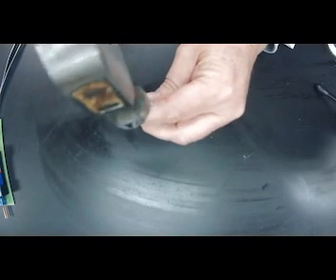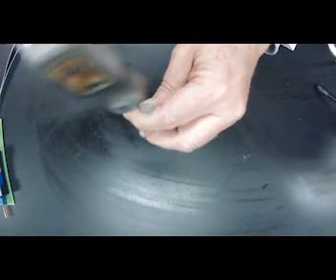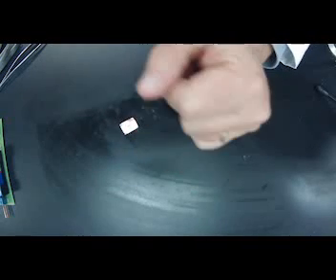Can I take it into a flat sheet, right? So let me get my hammer and my nail, and let's see if I tap on it, will it just break? Let's see what happens. And again, nope. It is not breaking apart. It is not brittle. It has malleability, okay? And it would also be very ductile, okay?